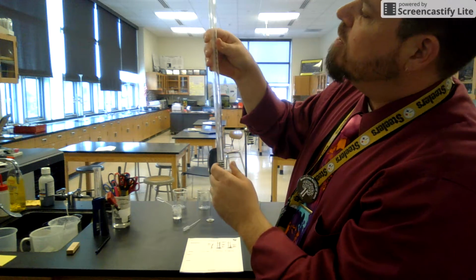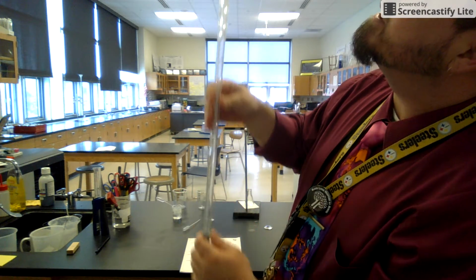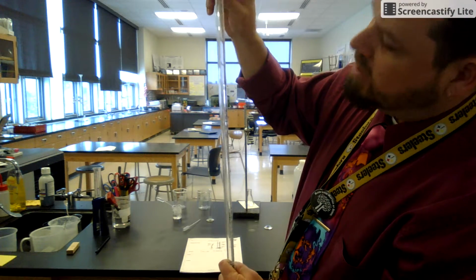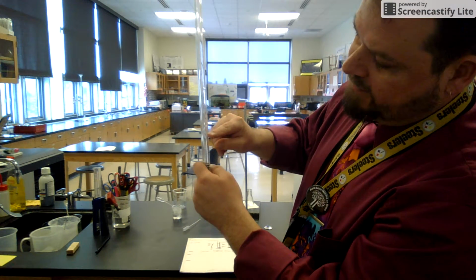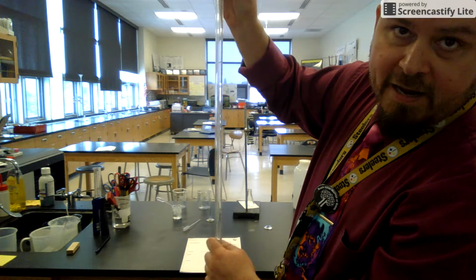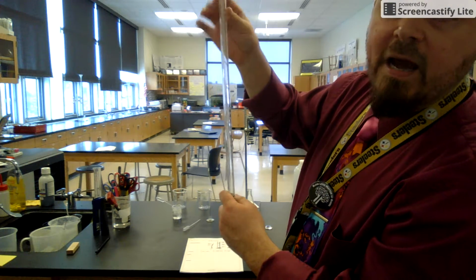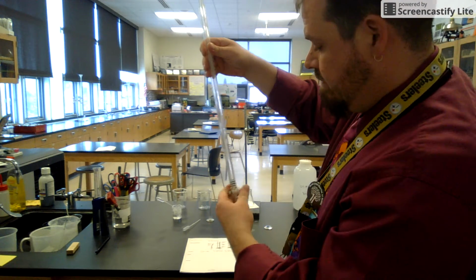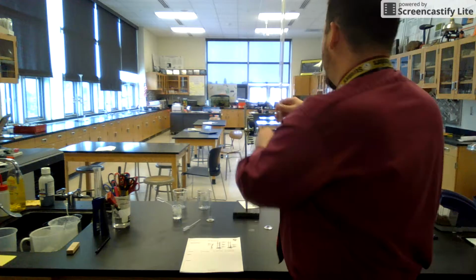The other thing, I don't know if you can see, but I'm up close to try and show you, is that this graduation goes opposite of a graduated cylinder. It starts at 0 and goes to 50 so that I can fill it up, figure out where my starting spot is. When I'm done, I can figure out how much I dispensed. So I'll need to know that for the lab. Okay, I'm going to go back, set it back up over here and show you how to do this lab.